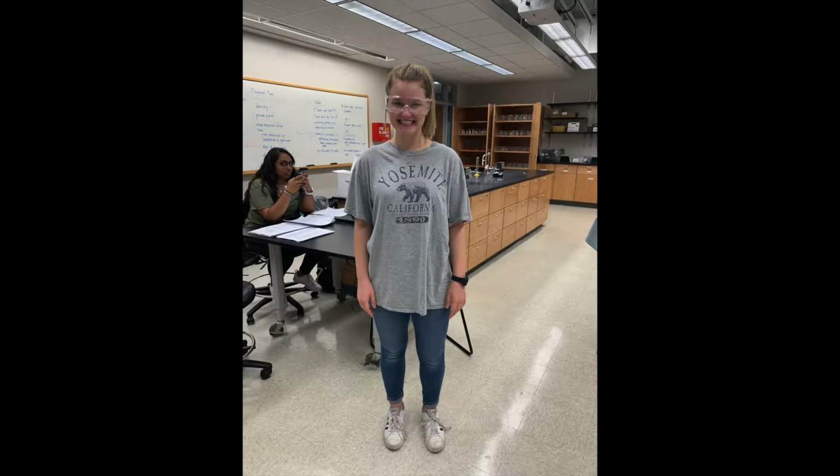To be able to begin the lab, we made sure all group members had appropriate lab attire, had hair up in a tie, and wore goggles during the entire lab.